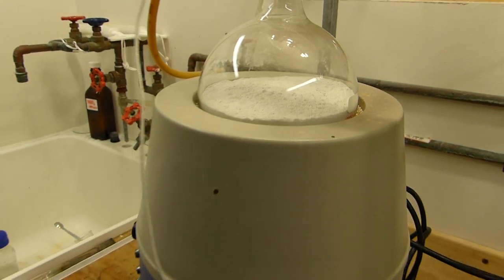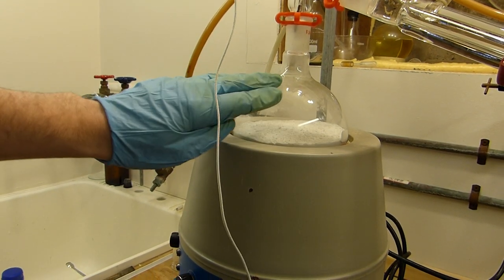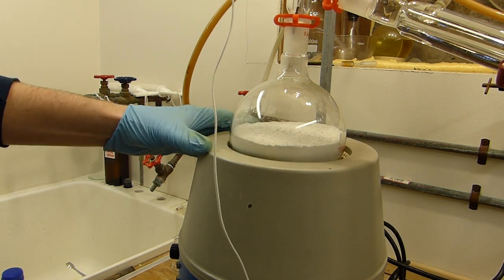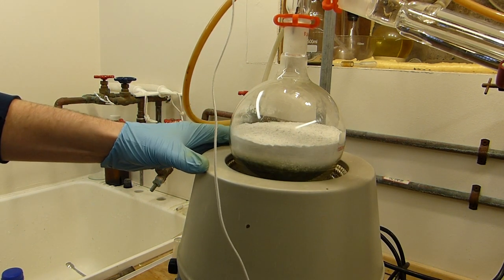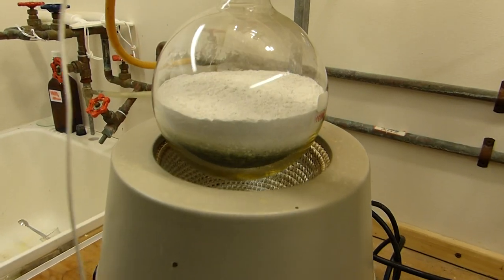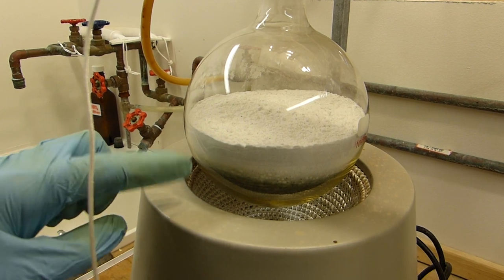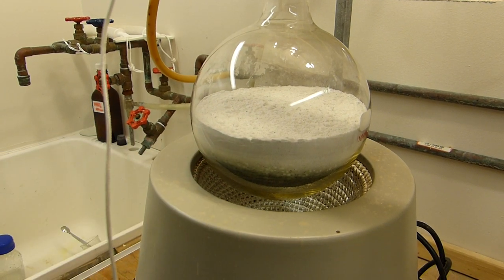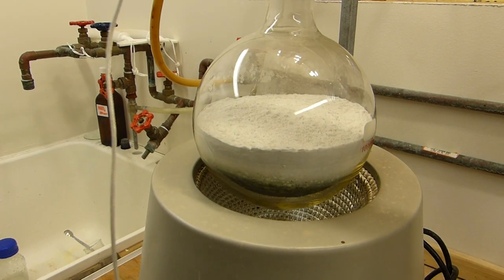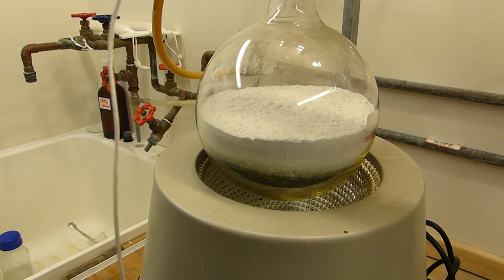I've been heating this for approximately 15 minutes and you can begin to see the reaction. There's some fog of subliming nicotinic acid here on the flask and also if I lower it, sorry about the squeaks, you can see that the nicotinic acid has sublimed away from the bottom of the flask and has formed this greenish black sort of solid here. So if I shake this I might be able to get it down but eventually it will fall by itself and then we'll begin to produce pyridine at a significant rate.